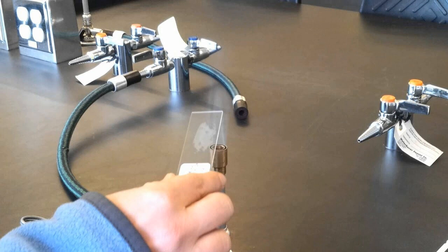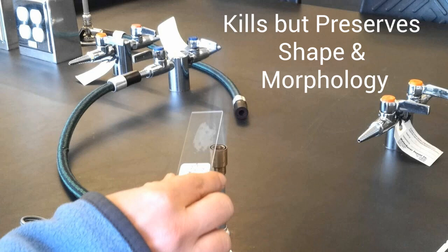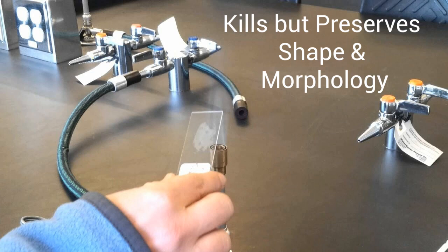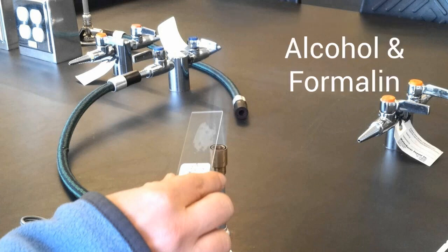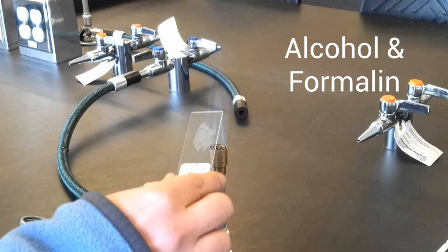The next step is fixation, where the air-dried smear is heated gently on a flame. Heat fixation simultaneously kills the bacteria and fixes them to the slide. It also preserves various cellular components in a natural state with minimal distortion. We can also use alcohol and formalin as fixating agents in place of heat.